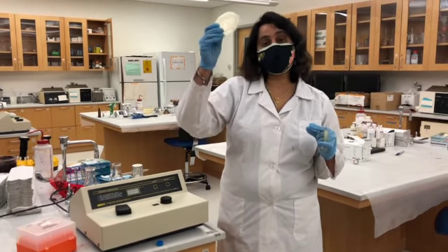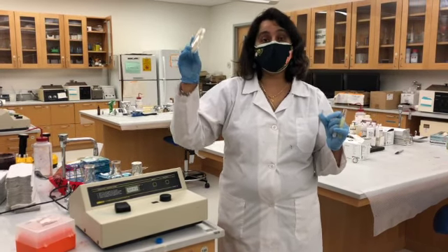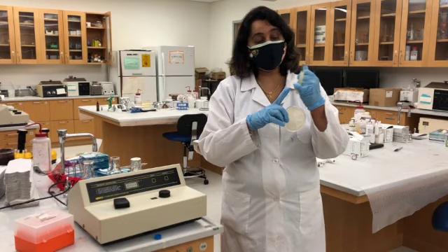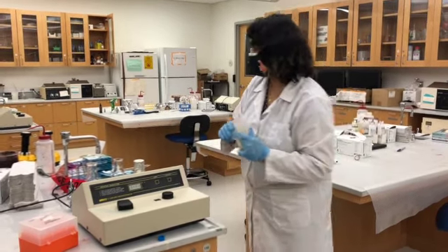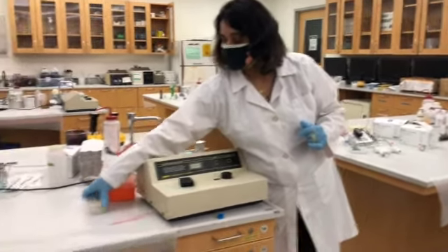When the bacteria can actively reproduce and grow, you're 100% sure that those bacterial cells are alive. Viability of the cells is always best studied when you grow them on the bacterial plates, not just simply by looking at their absorbance values. So that's the reason we always make sure you track the bacterial growth on these petri dishes.